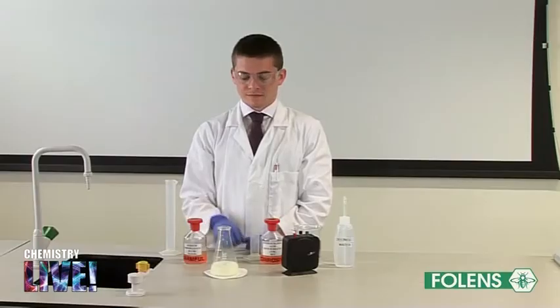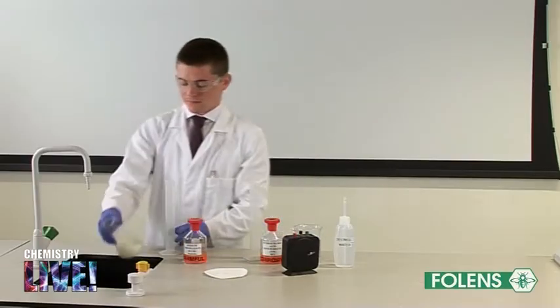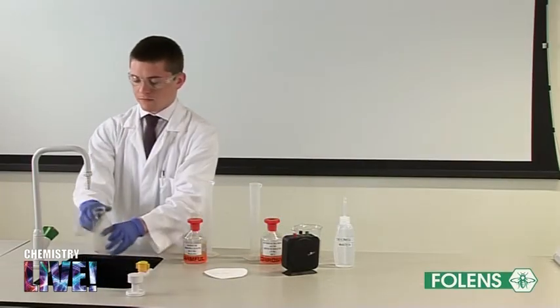Rinse out the conical flask and the graduated cylinder that contain the sodium thiosulfate solution.